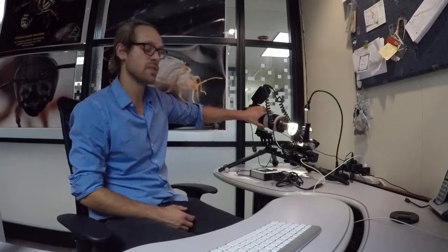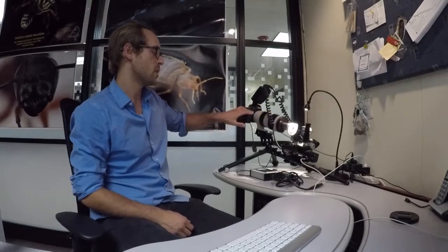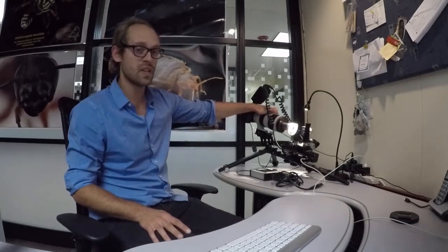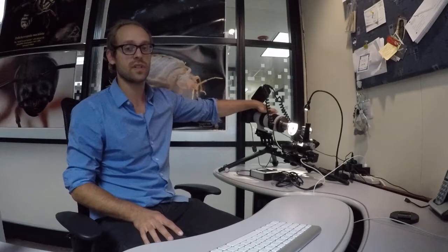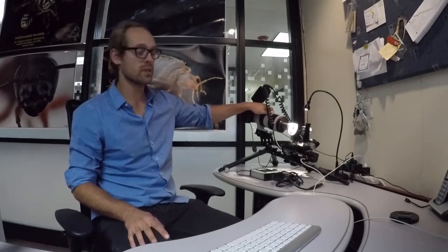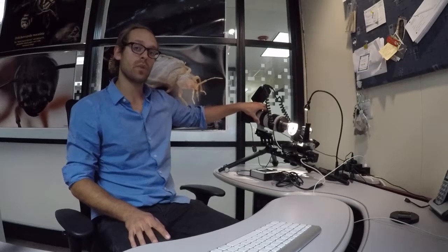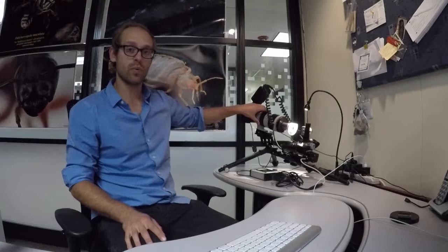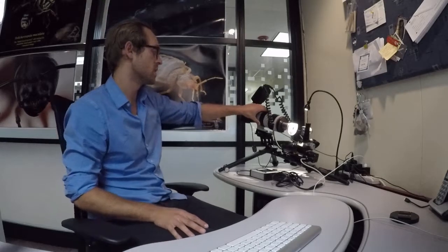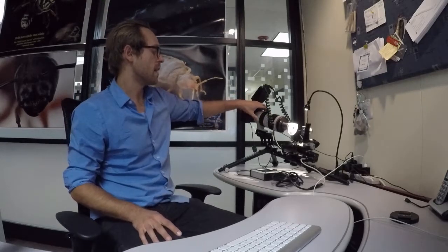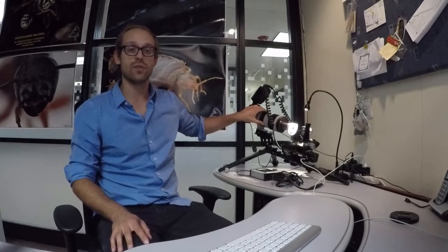Now once you have the entire system configured and all the cables plugged in, it's now time to configure the lens itself. So this lens comes with a lot of functions, ultrasonic motors for stabilization of changing the aperture and so forth. But all those features are effectively going to be turned off when using the objectives. So on the far side of this lens you have two stabilization motors. You want to set both of those to the off position. The working distance you're going to be working under short distances. You want to have that set to 1.2 meters as opposed to the greater distance. And then you want to have the autofocus turned off so that you're using it in manual focus.